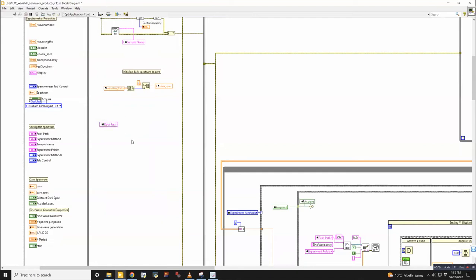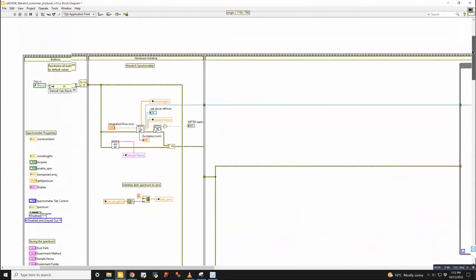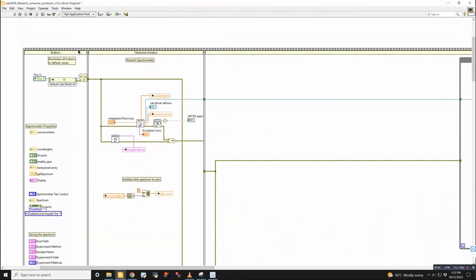So this is my preferred way of organizing everything. And then you can see all of your buttons here, and Sarah's done a nice job of organizing them. So all the dark spectrum buttons, all the saving controls, and all that stuff is neatly packaged up into one space. So overall, there's 4 sections in the sequence structure.